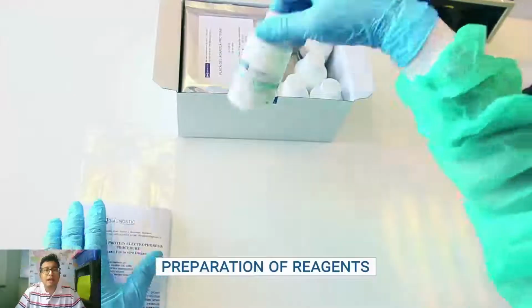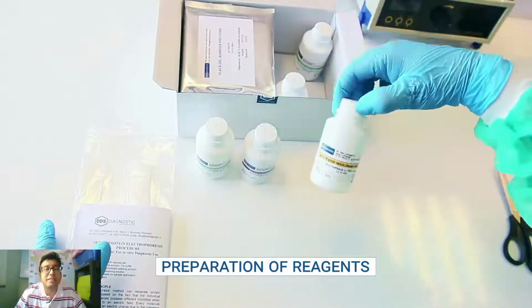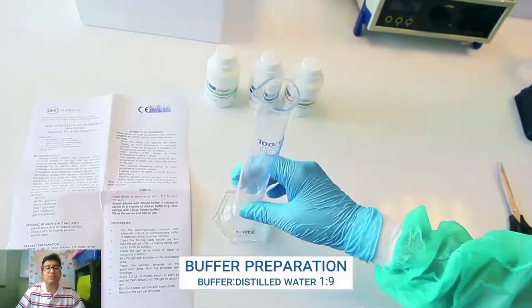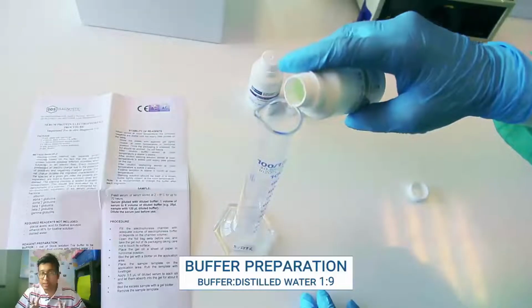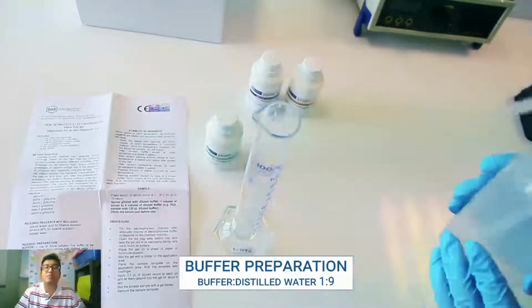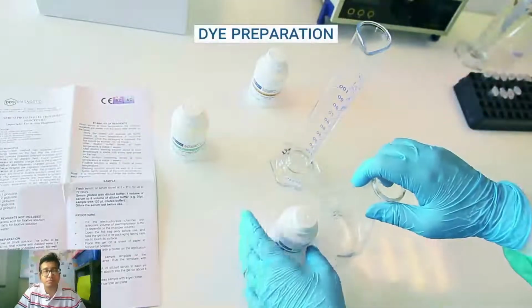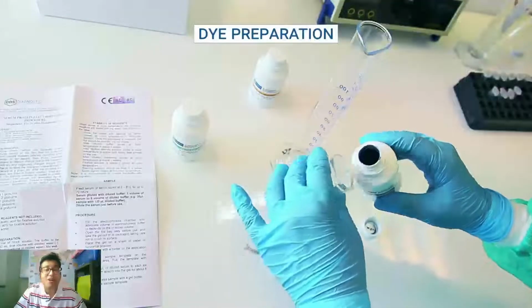First you will have a kit insert or a protocol, with the help of which you need to prepare the reagents. So what are the reagents? The staining solution, the destaining solution, and the proper mixture of protein. So you see over here, first we need to prepare the buffer. So either you need to weigh the chemical and then measure with distilled water, or you simply need to mix the reagents that are provided in the kit to prepare the buffer. The exact amount is always shown. So first the buffer is prepared, then we prepare Coomassie blue or amido black.